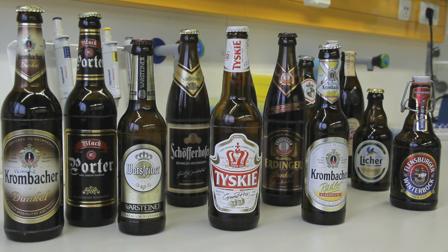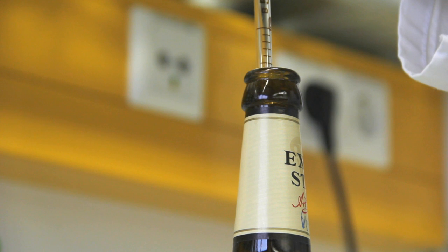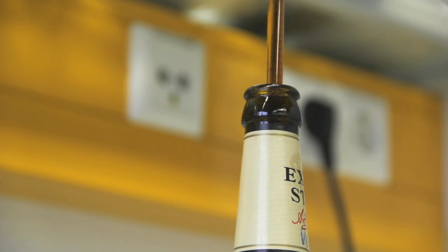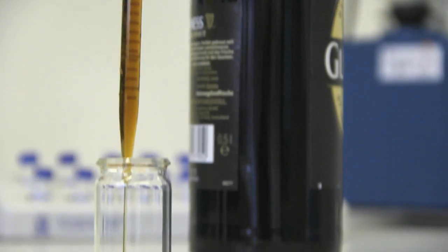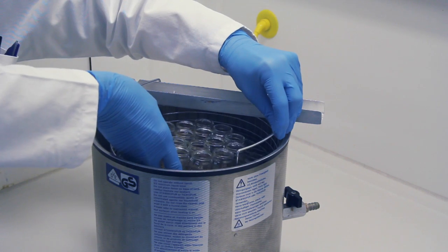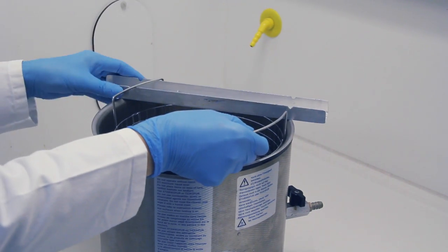14 different beer samples were investigated for estrogen-effective compounds present. The sample preparation of the complex beer samples was reduced to a minimum. 5 ml of the beer were pipetted into a sample vial and degassed in an ultrasonic bath for 30 minutes.